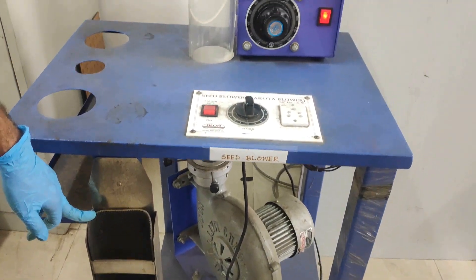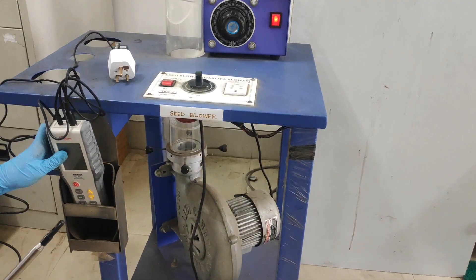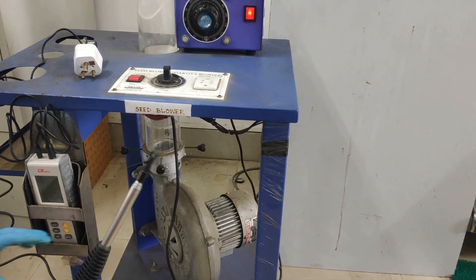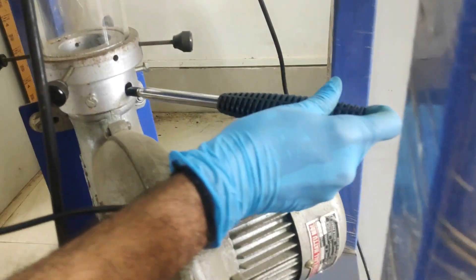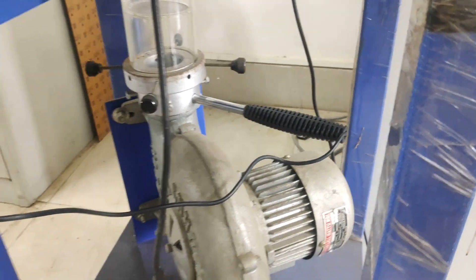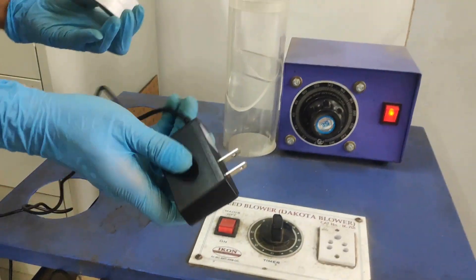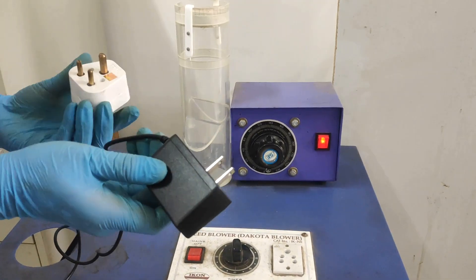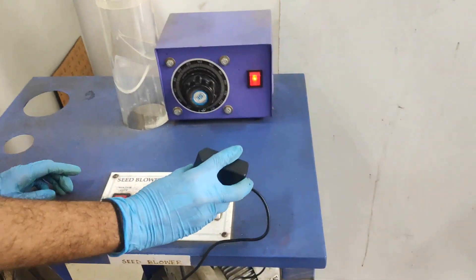Now let us prepare the machine for the experiment. Place the anemometer in the basket and put the hot wire socket into the space provided beneath the column so that temperature and velocity will be measured by the anemometer. The anemometer has an American socket, so we need to convert it with an Indian plug so that we can insert it into the given socket.